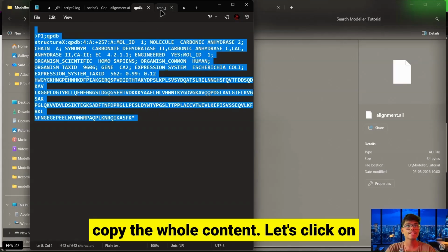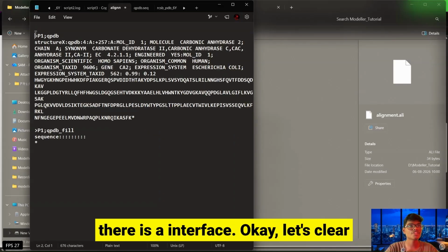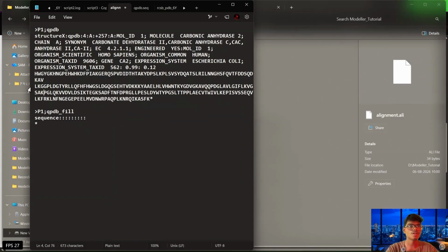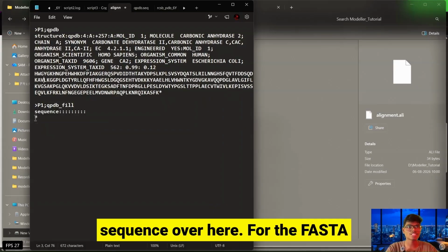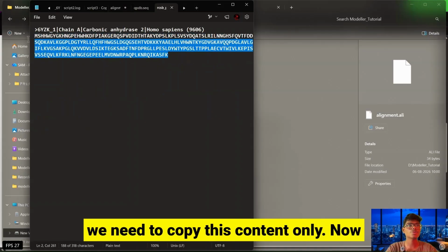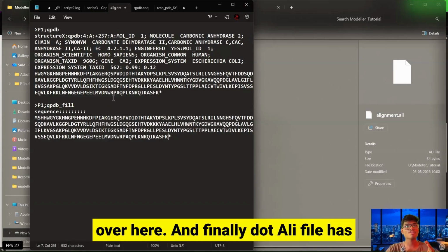Let's click on copy, and now we have to use the alignment.ali file. Now paste the sequence here, and then you will find there is an interface. Okay, let's clear the spaces. Okay, now we have done that successfully, and then we have to load the FASTA sequence over here. For the FASTA sequence, we are going to refer to this, and we need to copy this content only. Now click on copy, and paste the sequence over here. And finally, the .ali file has been constructed successfully.